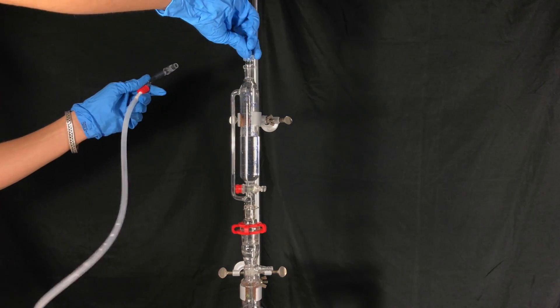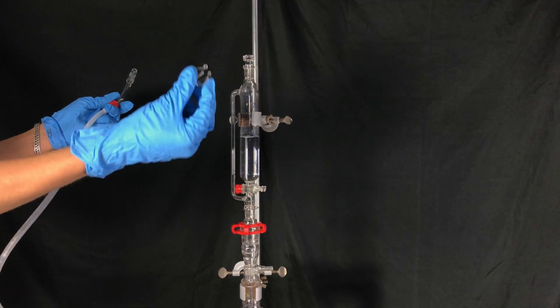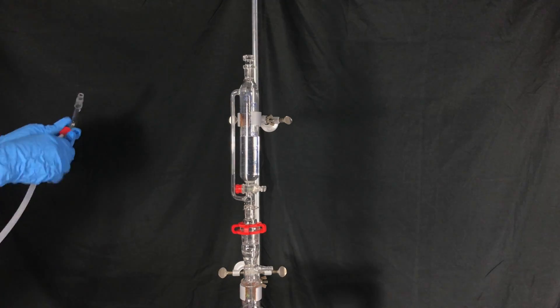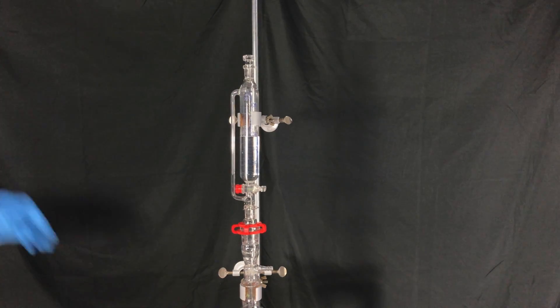Two minutes later there should be little to no oxygen left in our apparatus. The glass stopper wasn't secured to act as a sort of pressure equalizing safety valve.